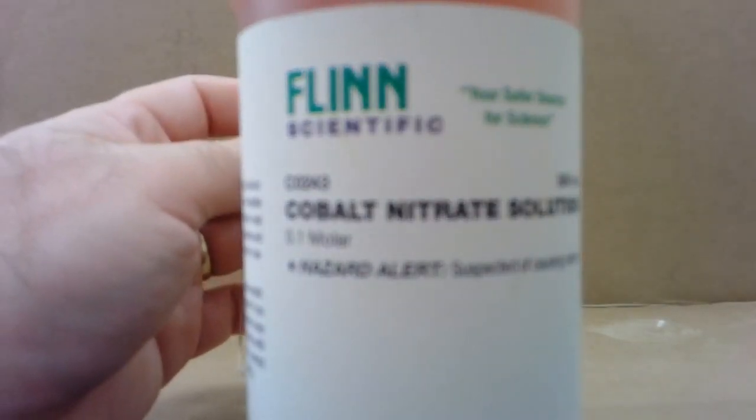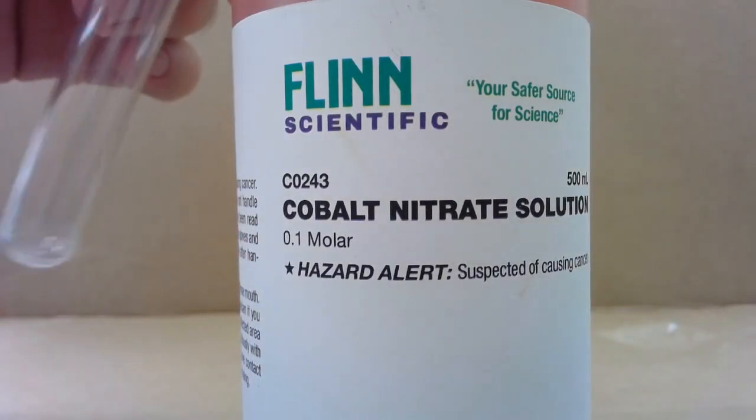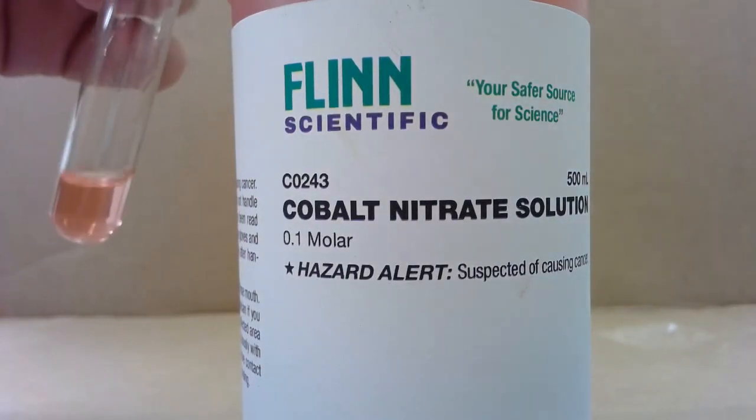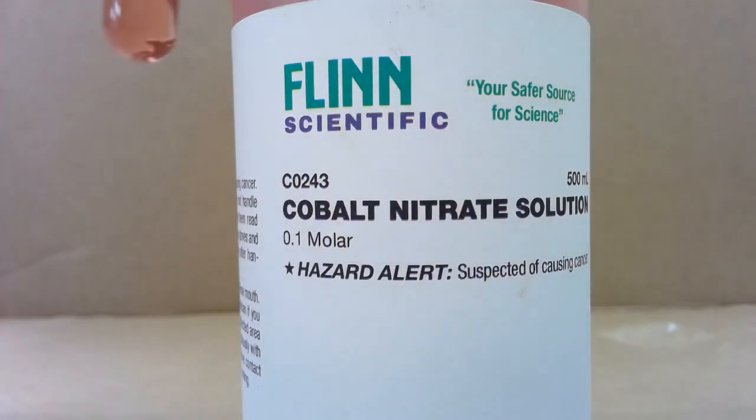And the last one we're going to look at, I have got here some cobalt nitrate solution. It's a bit pink. Cobalt nitrate solution.